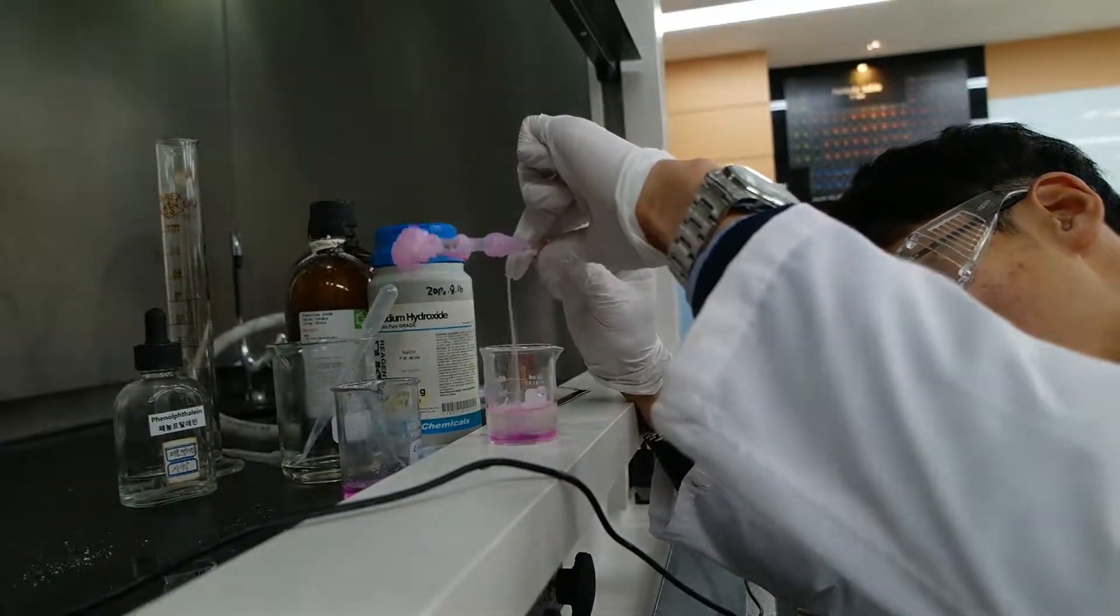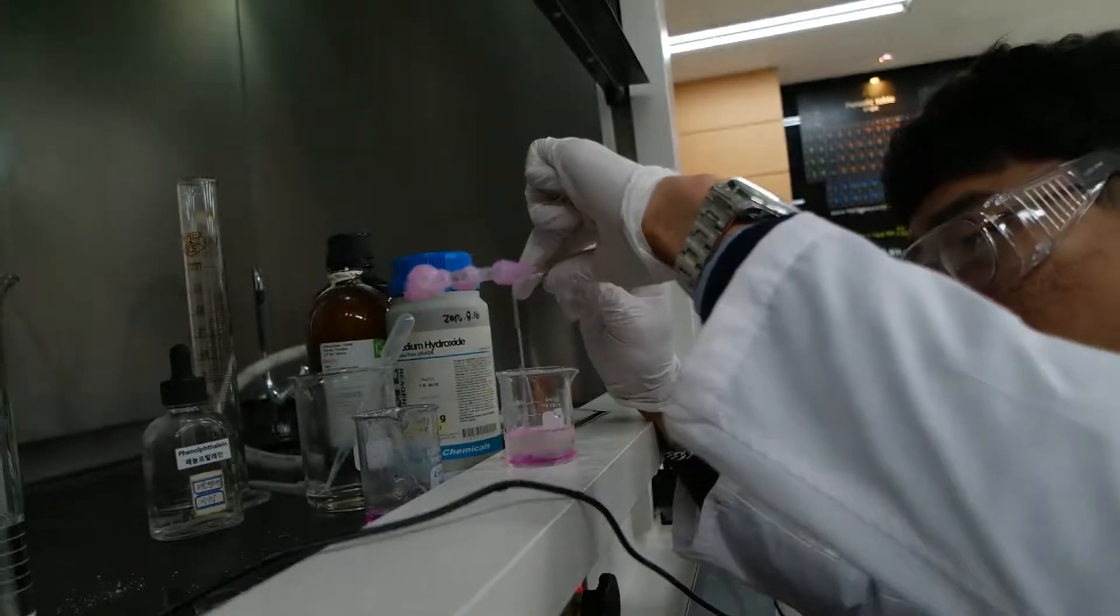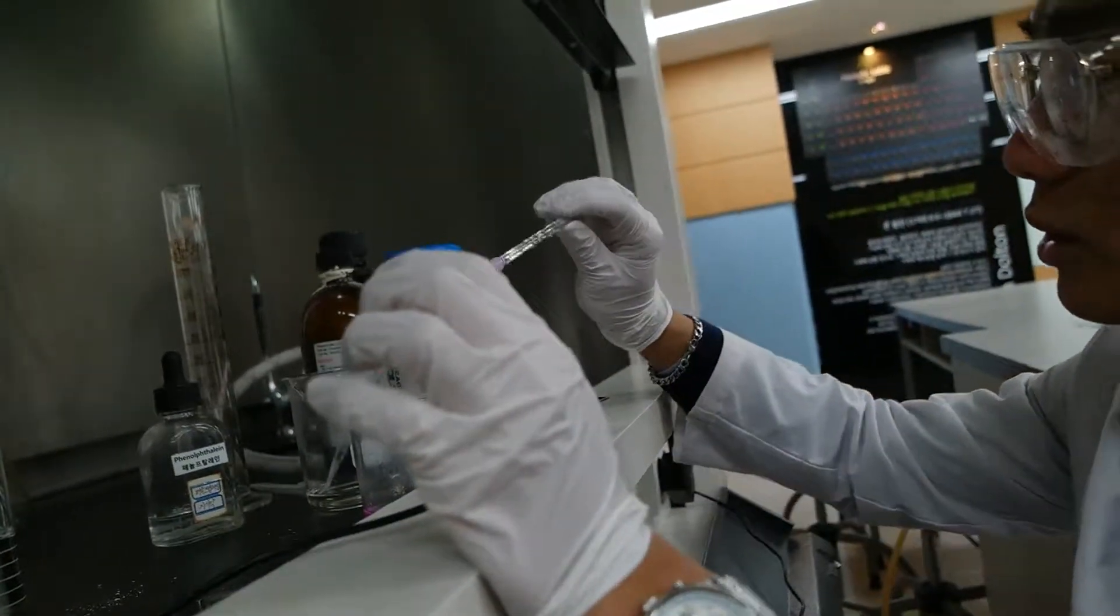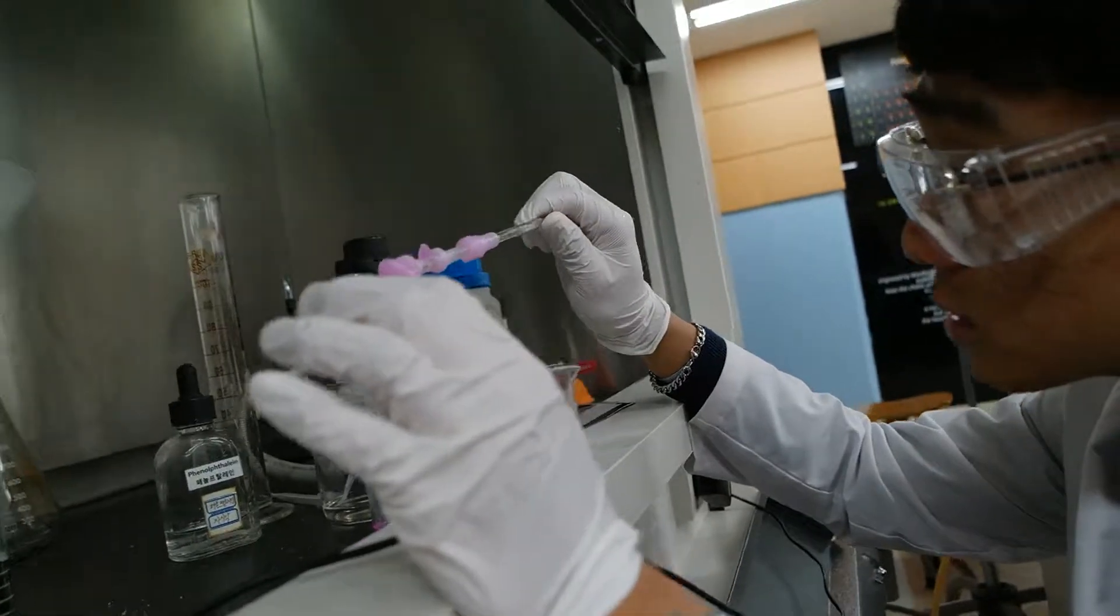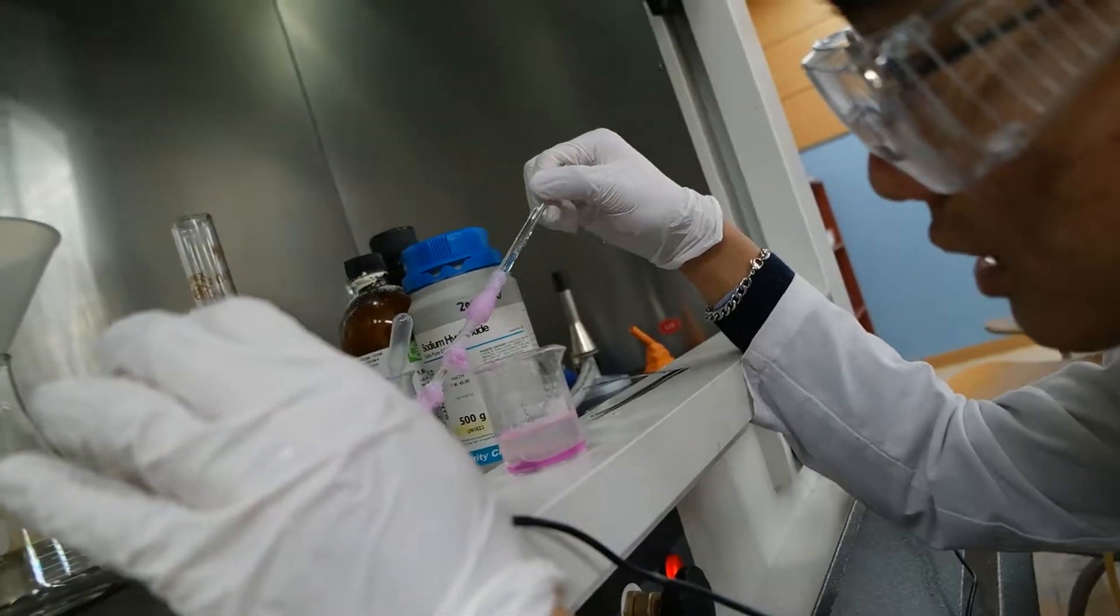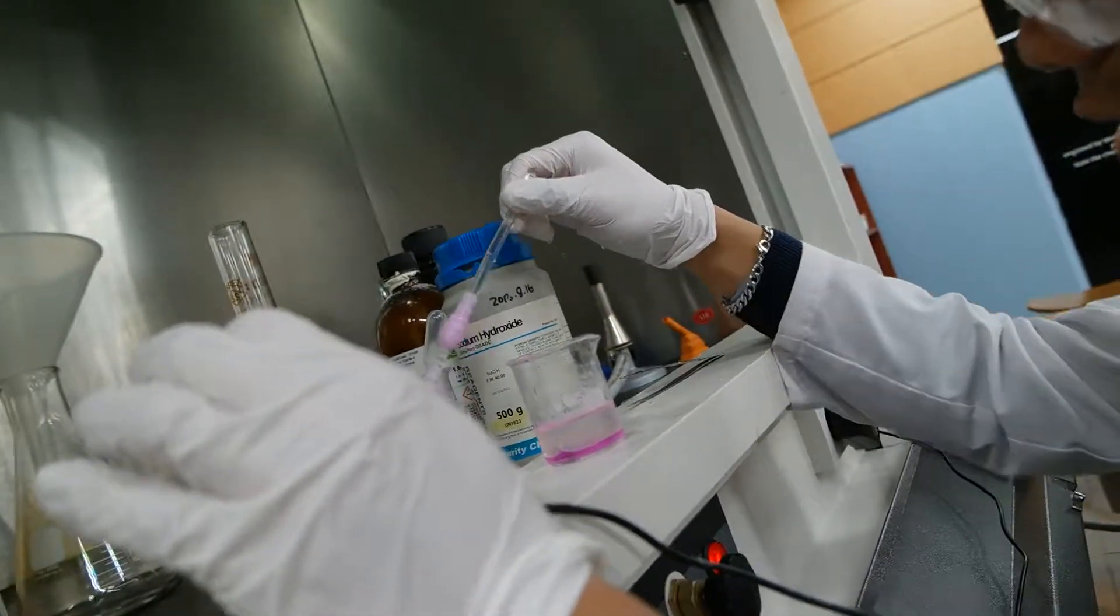In the internet, it says to drip the pink thingy along the wall so that there won't be much of a disturbance. Is it hot? Can you touch it? I don't want to touch it. It's scary. Don't touch it. It's basic, it's so hot.